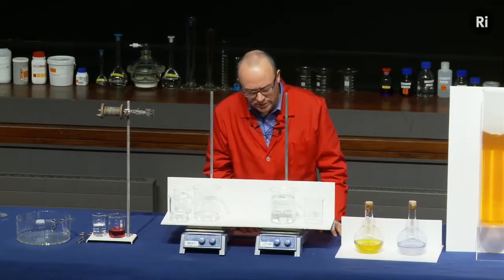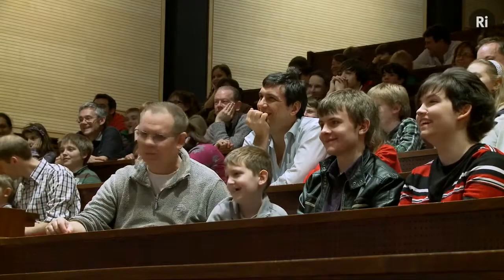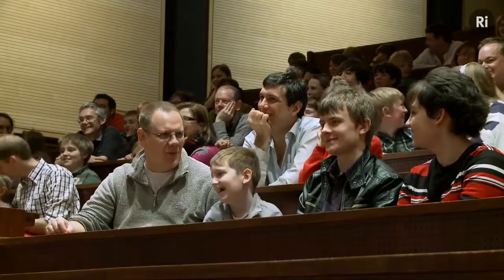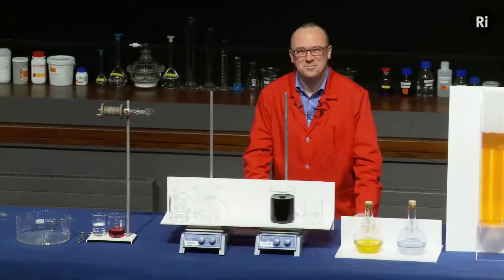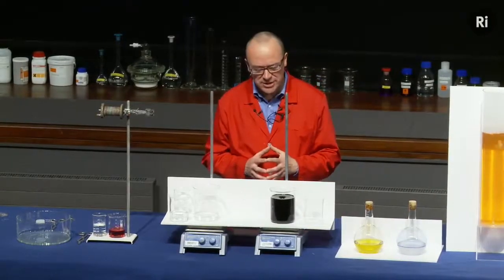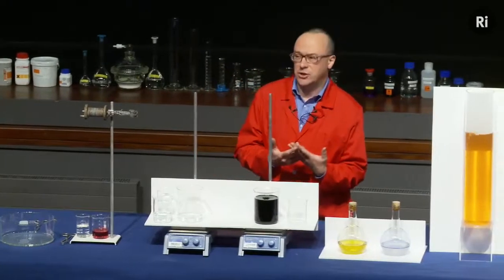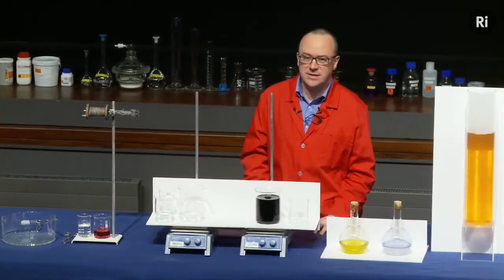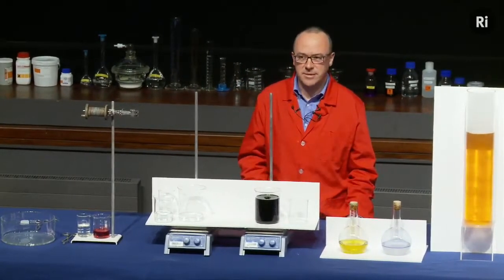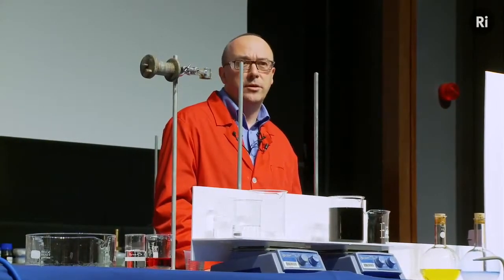So keep watching. Very strange indeed. We mixed the two chemicals and it seemed as if no reaction took place. It just sat there for 10 seconds and then suddenly it reacted. Now that seems very odd, very surprising. But what was really going on?